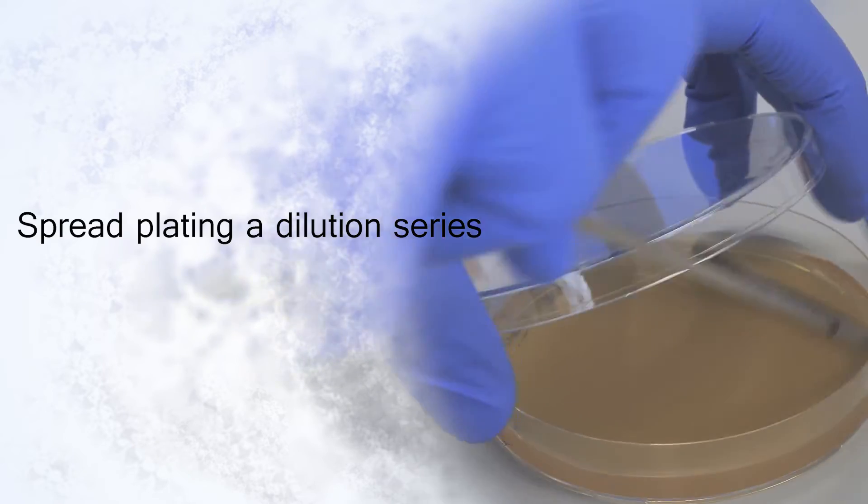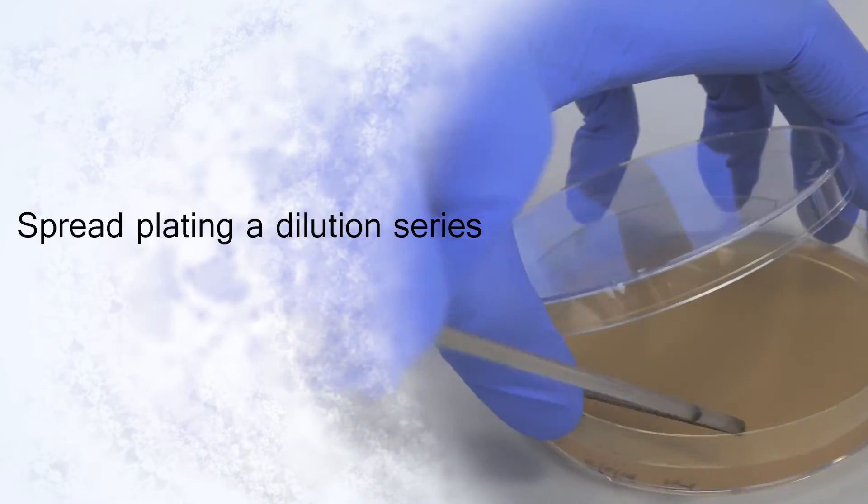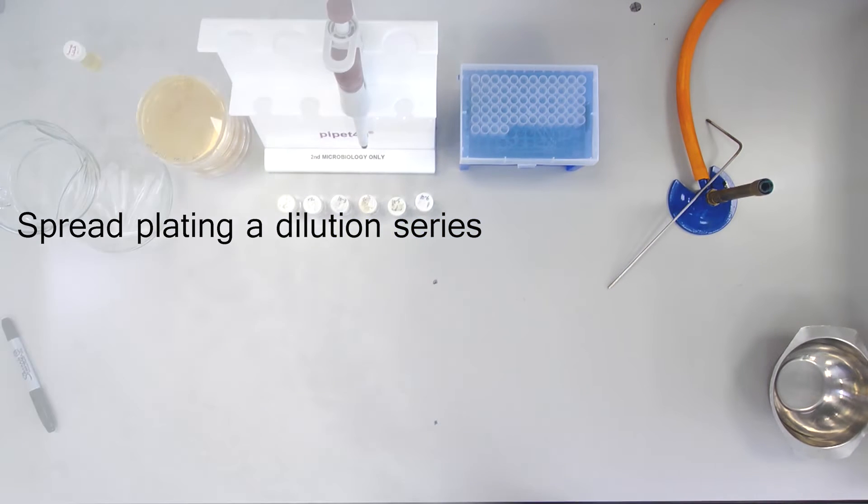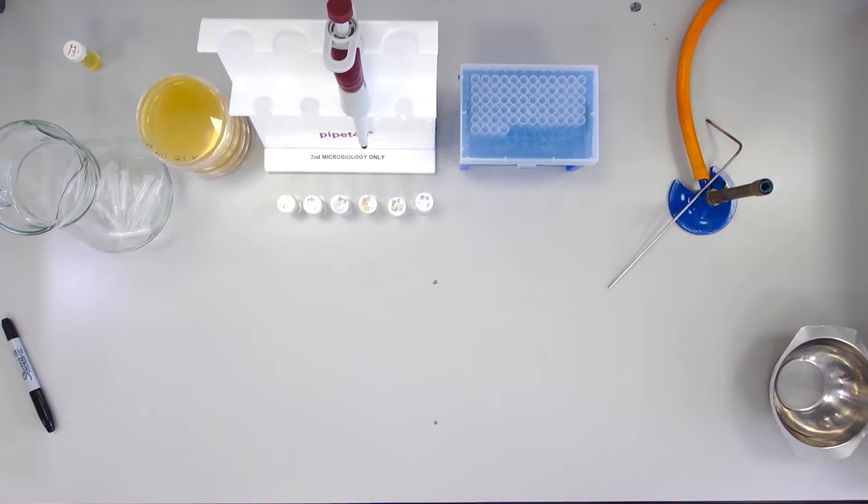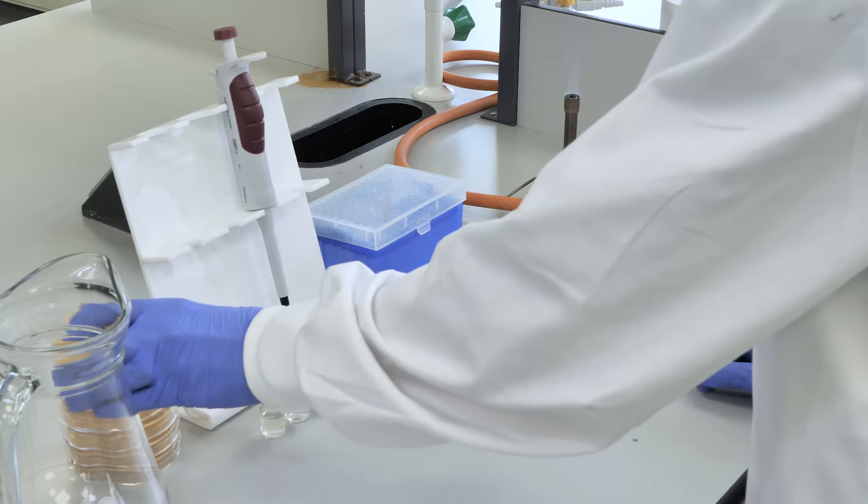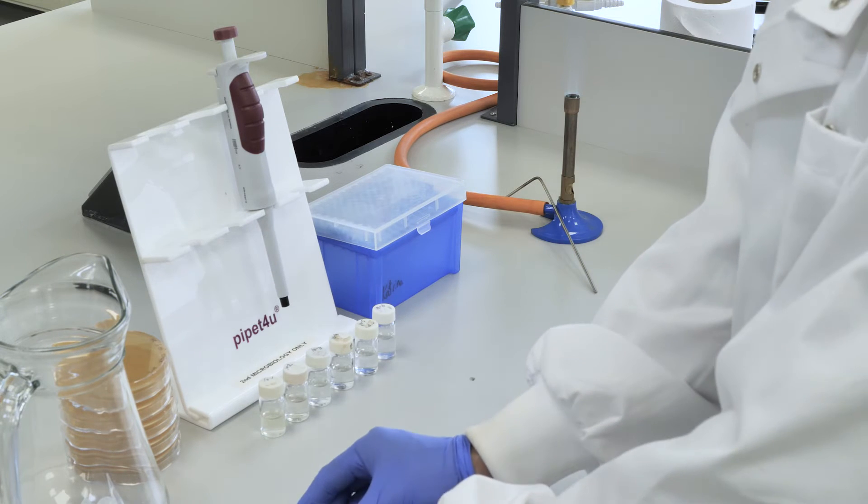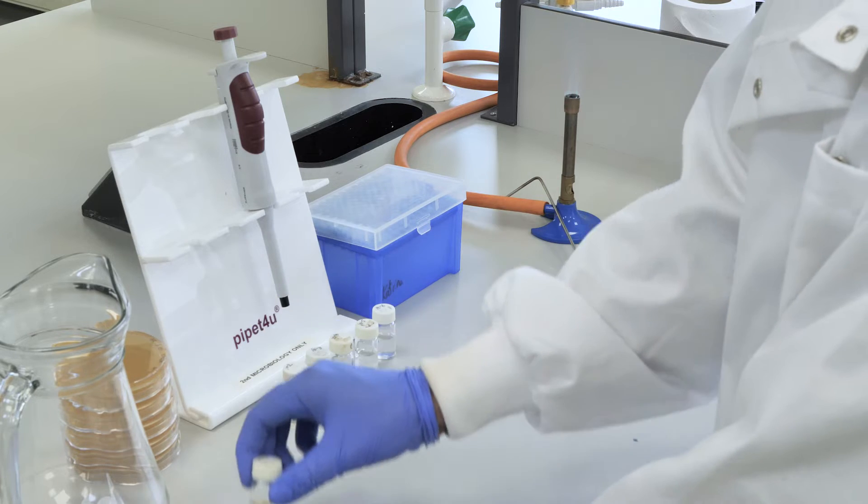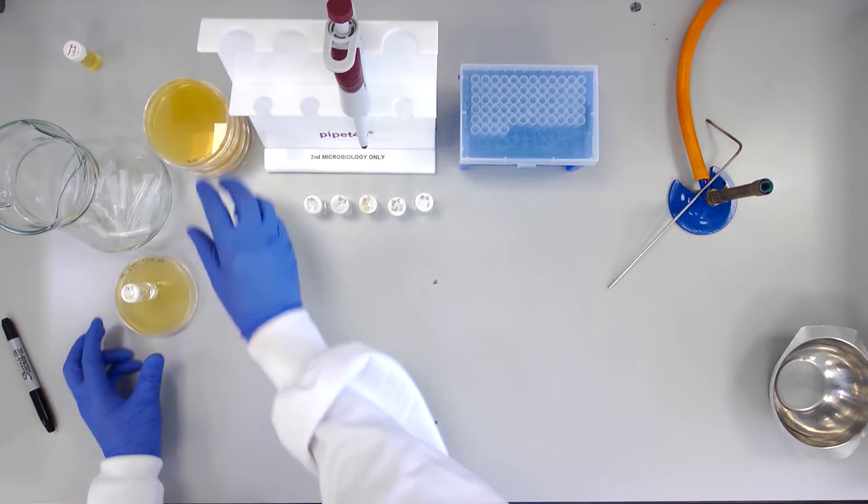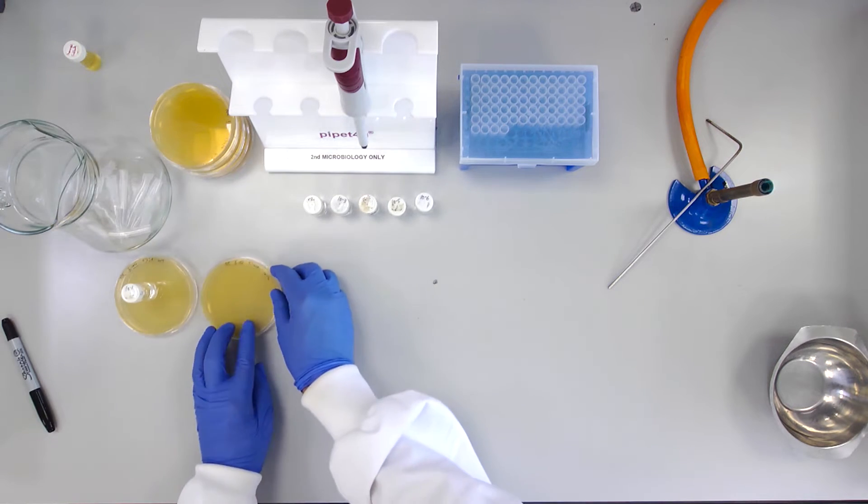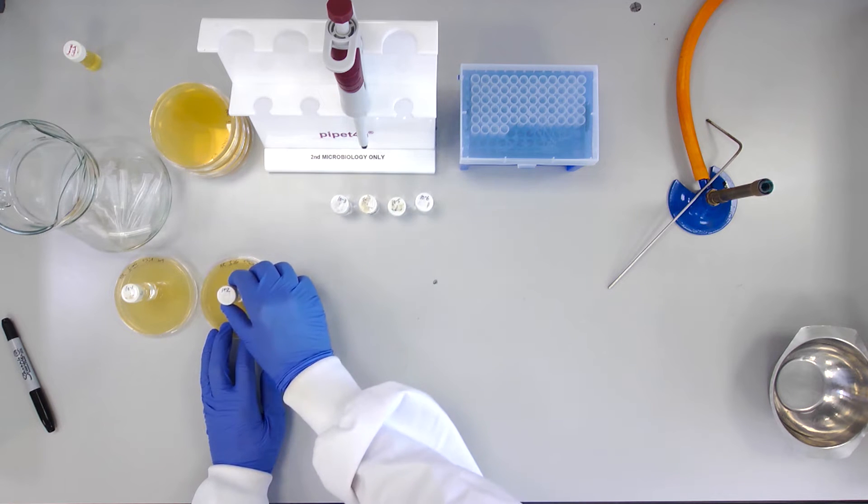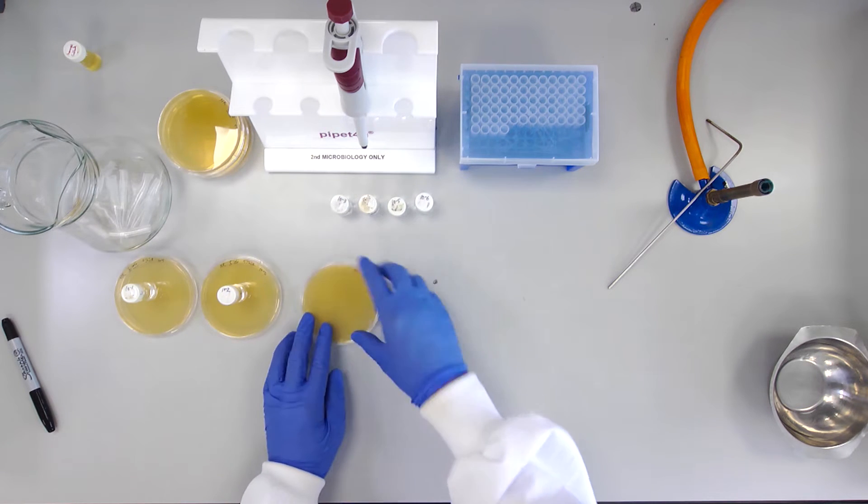Spread Plating a Dilution Series. With the serial dilutions complete, it is time to spread plate each dilution onto an agar plate. Arrange each liquid suspension dilution with the plates labeled for that dilution.